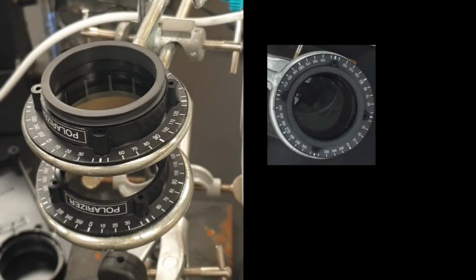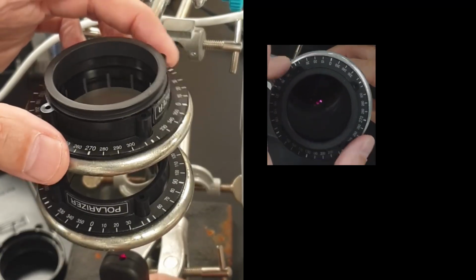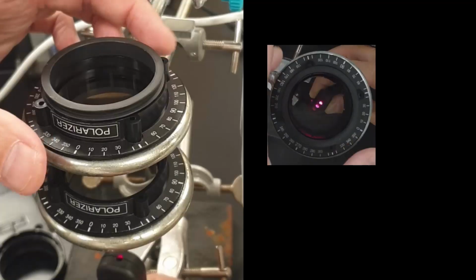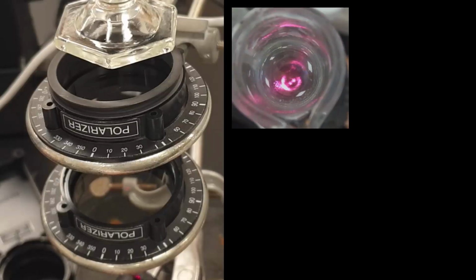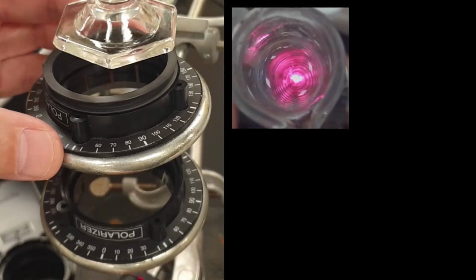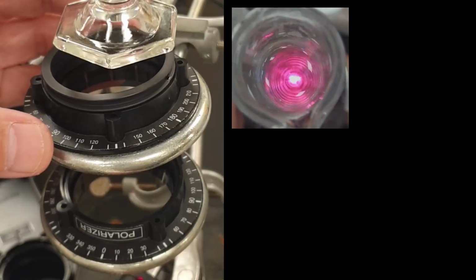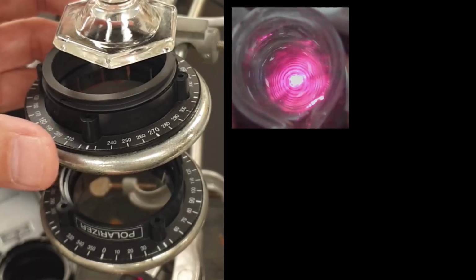Okay, so now I'll move over to the final one. So me not knowing whether it's 90 or 270 is an issue. And so now I actually use the real substance, and you can see, I'm going to slowly turn it. You'll see a little white line come up. So that's 100% through, and then it sort of cuts out here, which is 110. And it's meant to cut out at 90, but it was 10 degrees out. So I'm thinking I'm getting a 10 degree rotation.